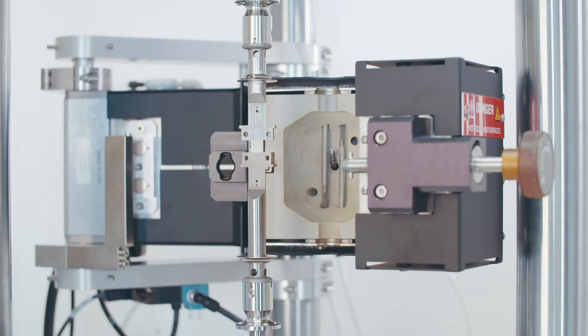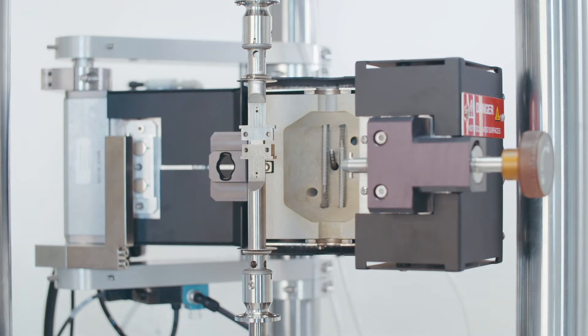First, make sure that your grips are aligned well. The alignment routine varies with testing geometry. We are showing you a set of tensile grips.